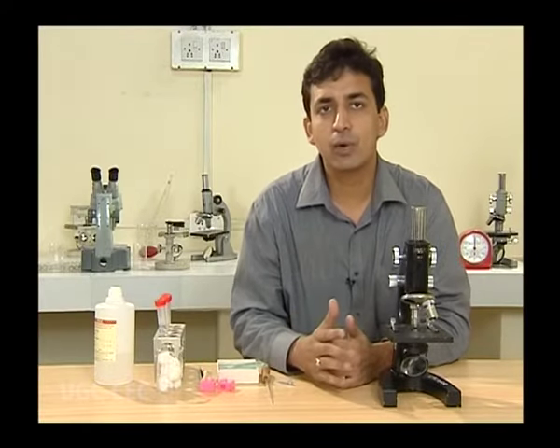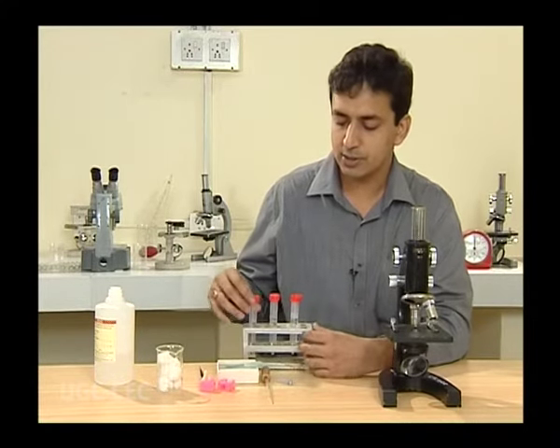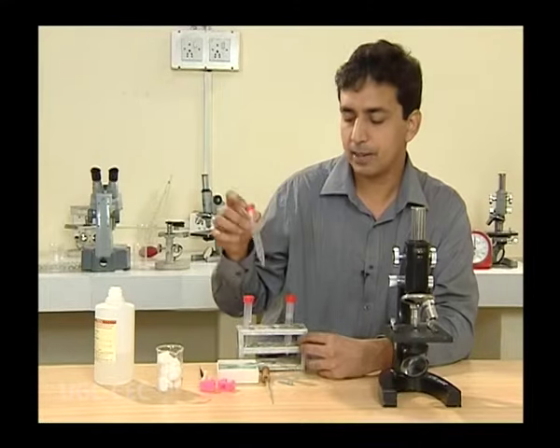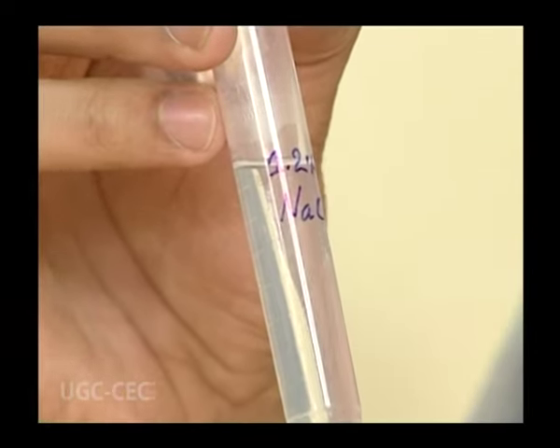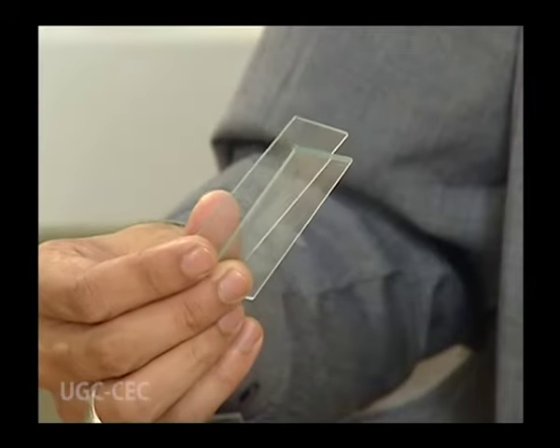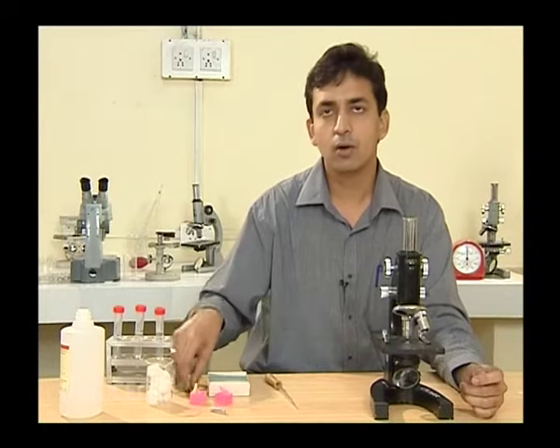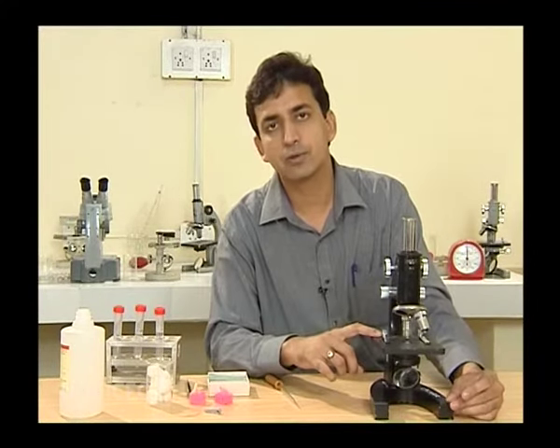Now let us gather the materials needed for this experiment. We need three saline solutions: 0.6% saline (hypotonic environment), 0.9% saline (isotonic environment), and 1.2% saline (hypertonic environment). Apart from this, we also need alcohol for disinfection, glass slides, cover slips, a dropper, forceps, a pricking needle, and a compound microscope to make observations.